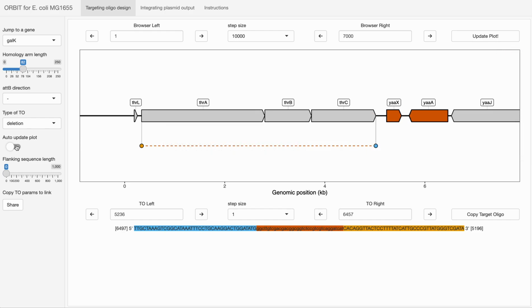See, now I'm used to auto update. Okay, we gotta turn our auto update back on. Okay, you can do this another way by using the lasso selection here. And that also works.